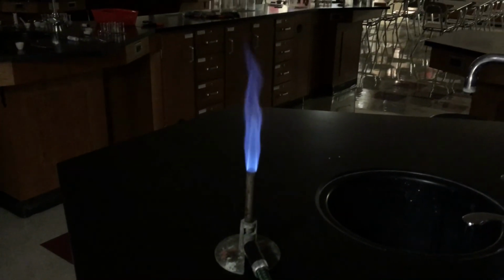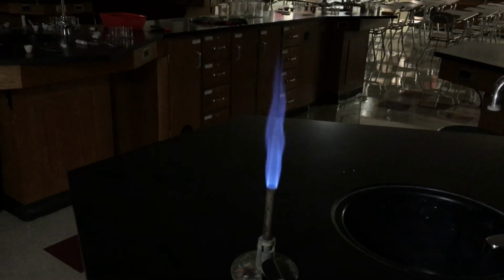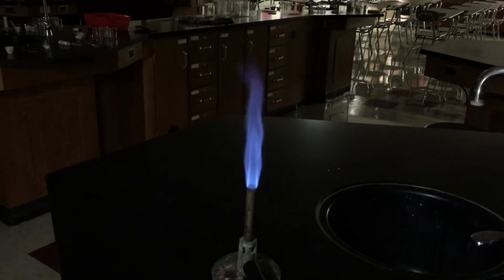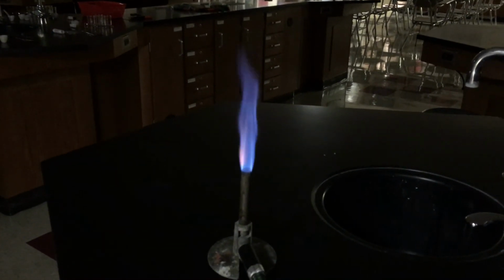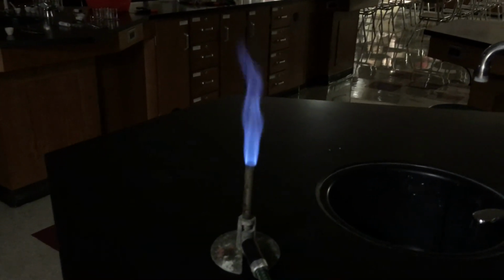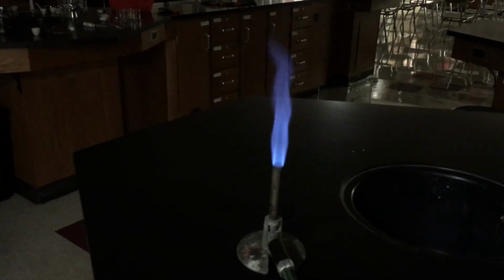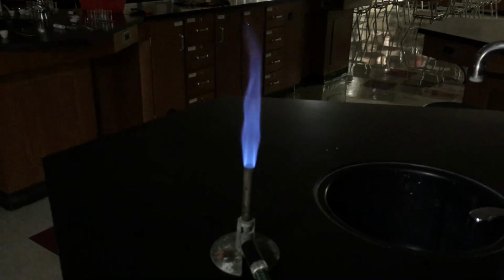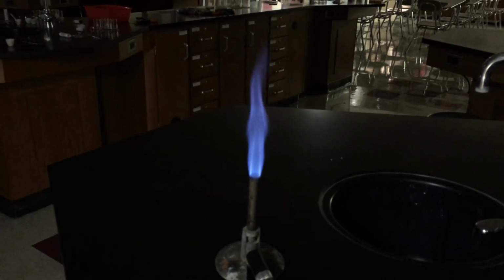Since that's kind of an uncomfortable position, they can do it as long as they can hold on to that energy, but at some point they've got to go back to their comfortable place, which we call the ground state. When they return to the ground state, they have to do something with that excess energy, so they release it as light. So what we're going to do is basically put energy into some different chemicals.